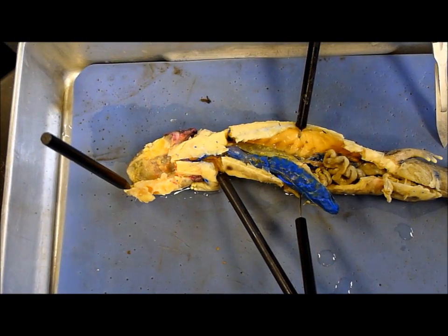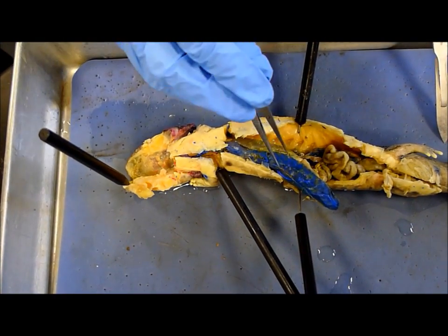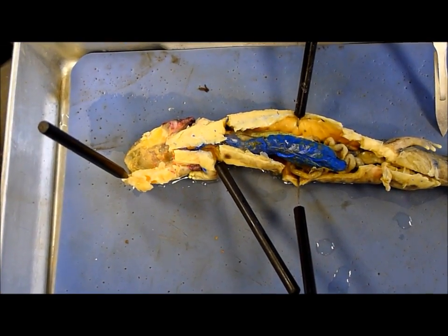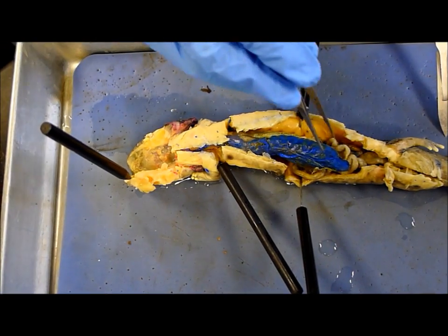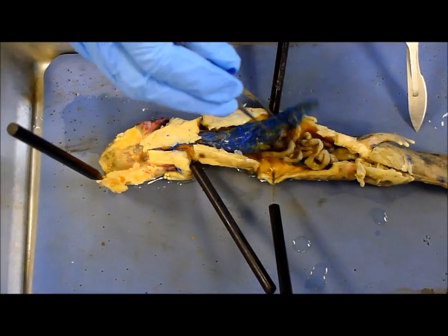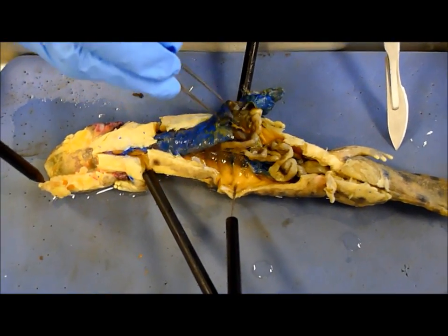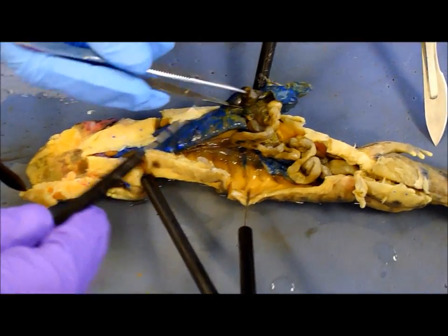The liver. The gallbladder is this little balloon-like thing right here.